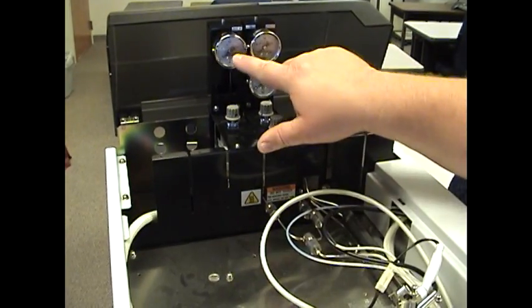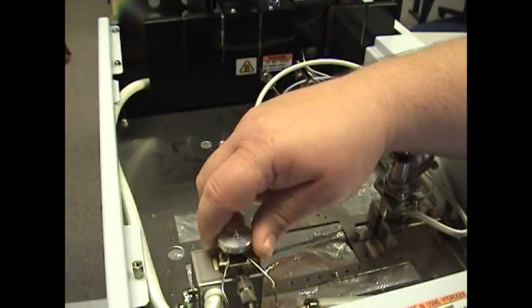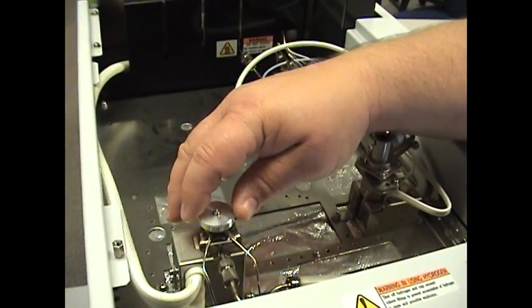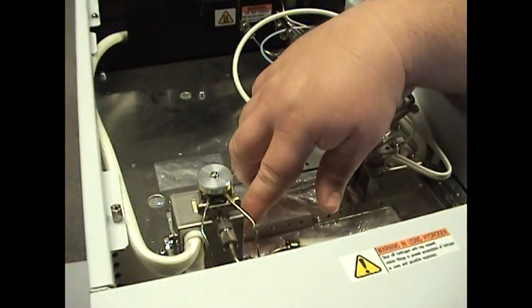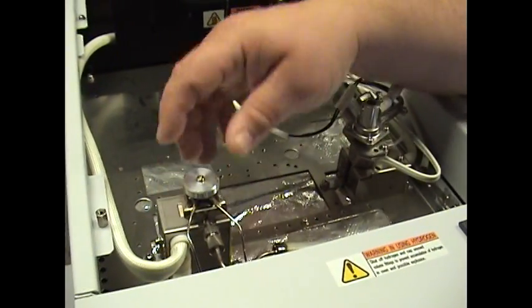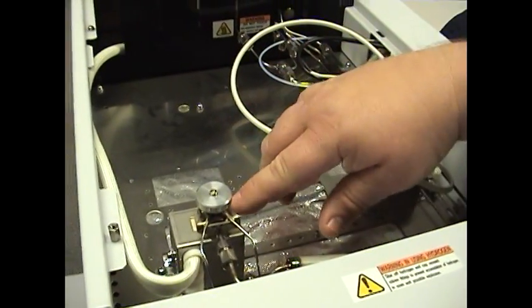If that does not read zero, you still have head pressure on here. So what happens once you open this up, you will hear a pop. If you hear that pop, you need to replace the glass liner as well. That means you had pressure build up and it dislodged the quartz wool inside the injection port.